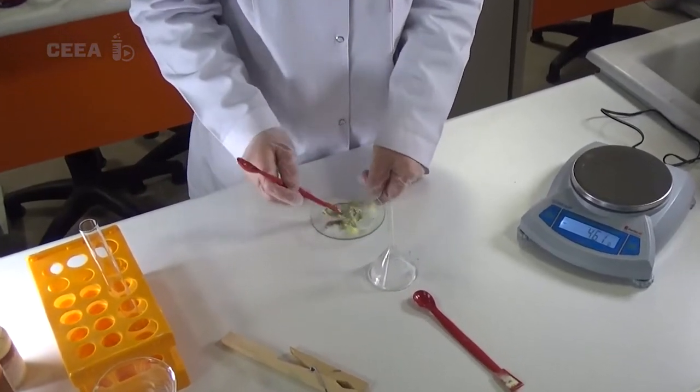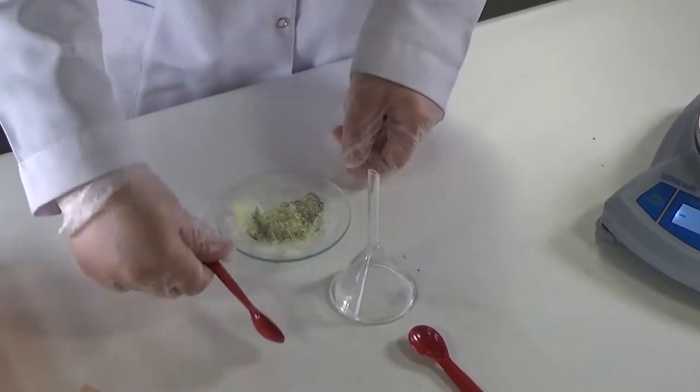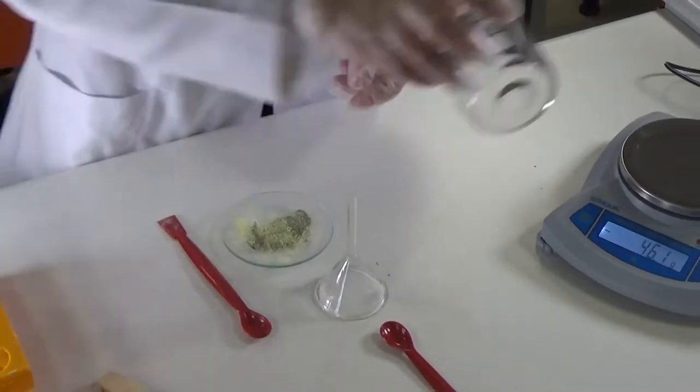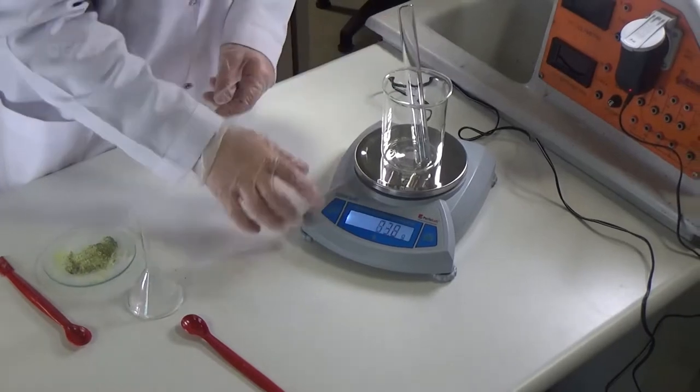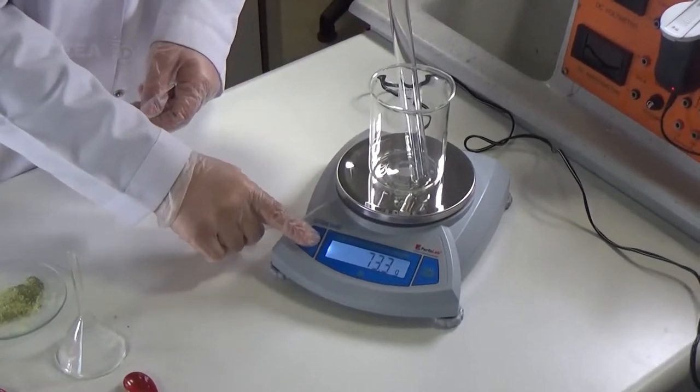Then a beaker is put on the scale with an empty test tube and its weight is reset.